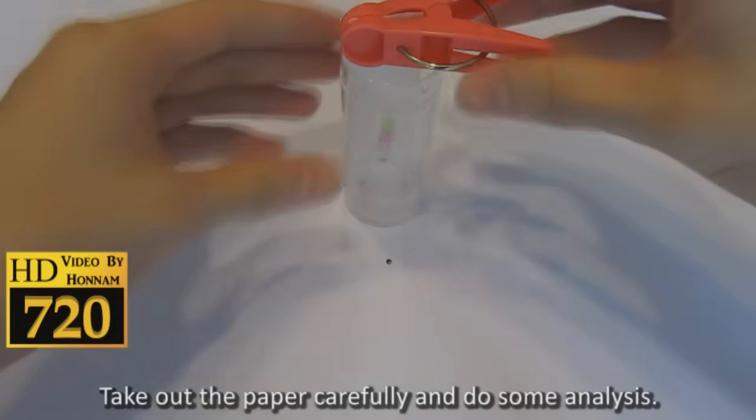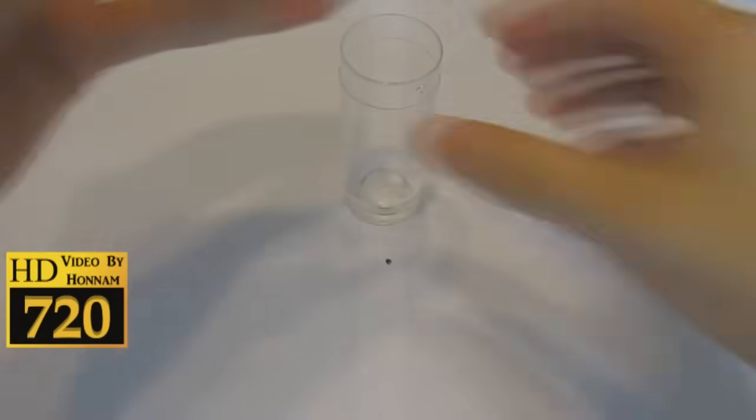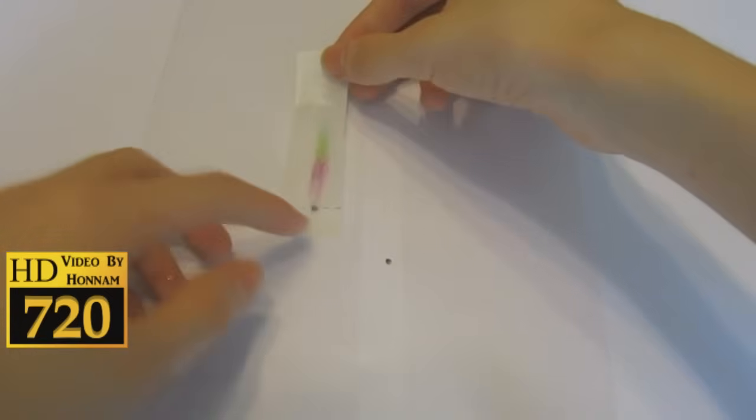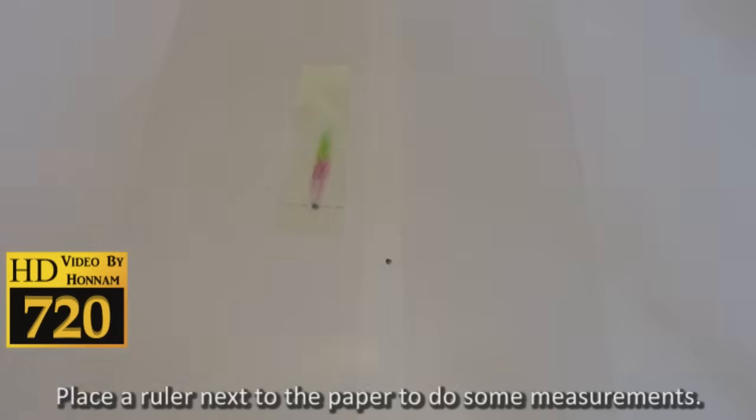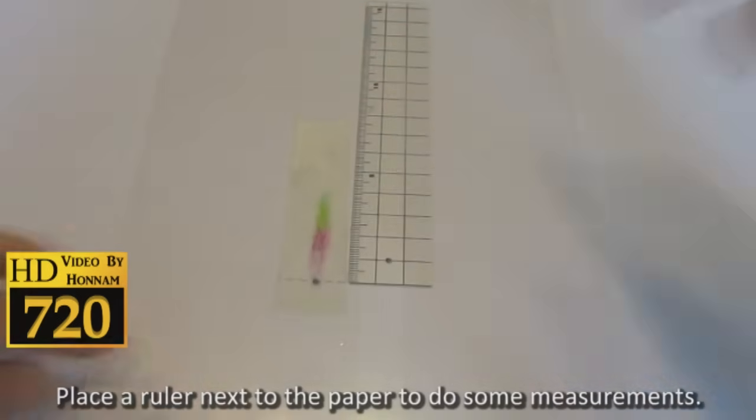Take out the paper carefully and do some analysis. Place a ruler next to the paper to do some measurements.